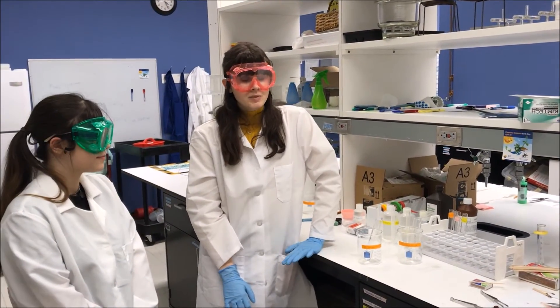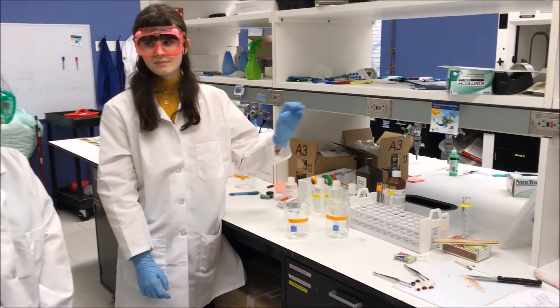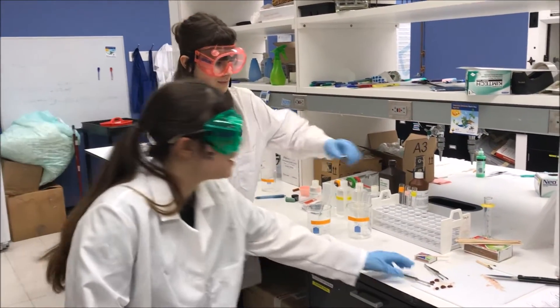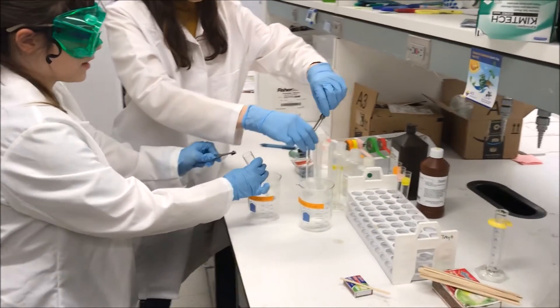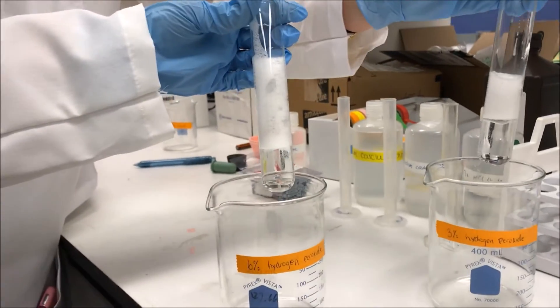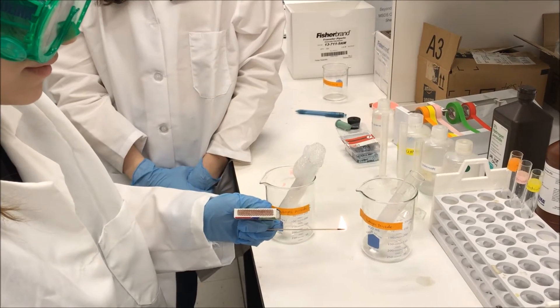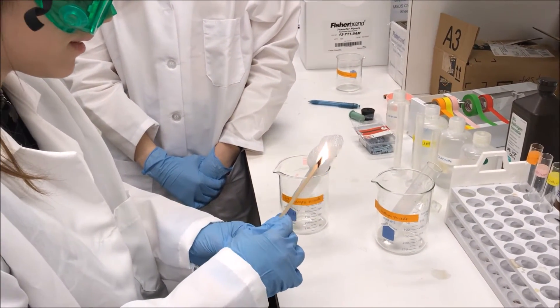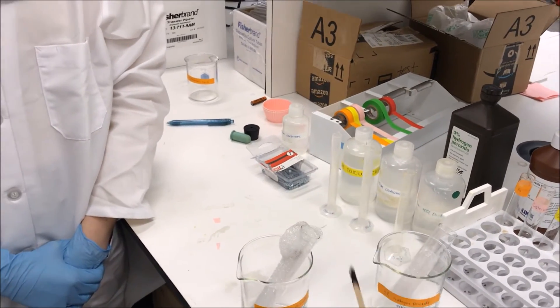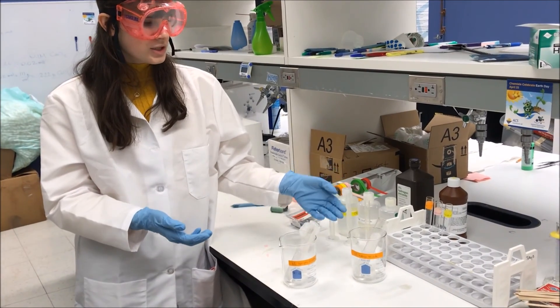This is reaction type C and we are doing the first procedure. We've already pre-measured 15 milliliters of six percent hydrogen peroxide and three percent hydrogen peroxide into two test tubes. The procedure calls for potato as a catalase, but we will be using beef liver instead as it works just as well. Taking two pea-sized samples of beef liver, making sure that you put it all the way down. The catalase is breaking down the hydrogen peroxide and forming oxygen bubbles. We can test for the oxygen bubbles by using a glowing splint test. This is an example of decomposition, and by comparing the six percent to the three percent we can see the effect concentration has on rate of reaction.